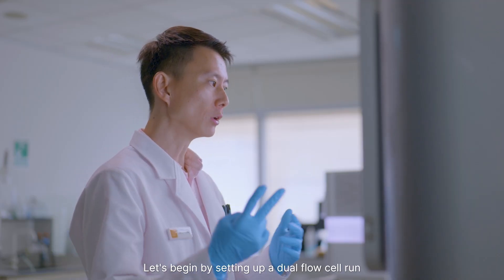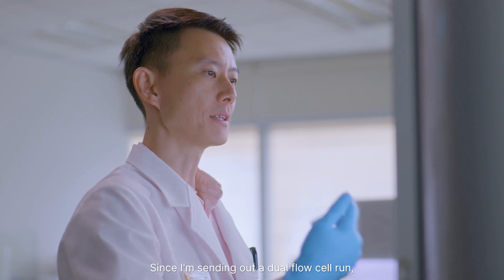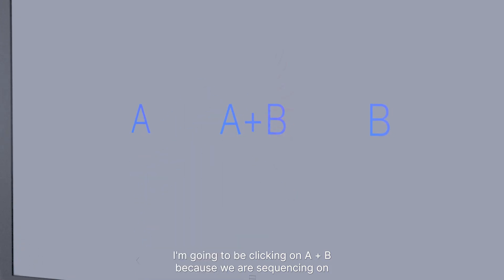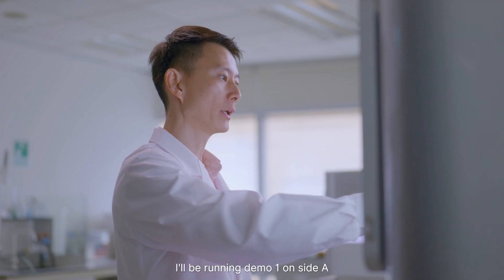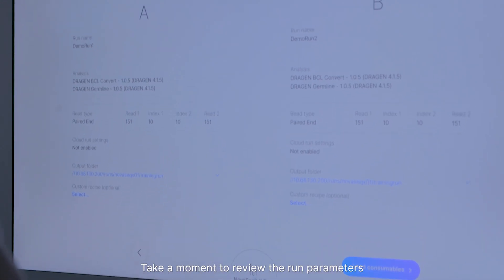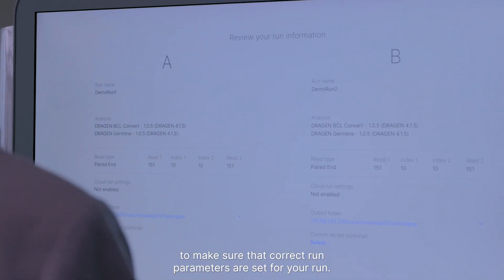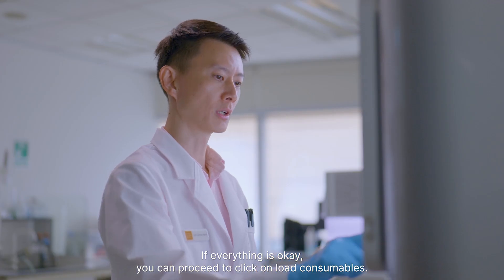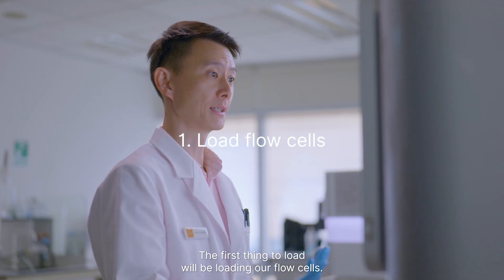Let's begin by setting up a dual flow cell run on the NovaSeq X Plus. Since I'm setting up a dual flow cell run, I'm going to be clicking on A plus B because we are sequencing on both sites A and B. I'll be running demo run 1 on site A and demo run 2 on site B. Take a moment to review the run parameters to make sure the correct run parameters are set. If everything is okay, you can proceed to click on Load Consumables. The first thing to load will be our flow cells.